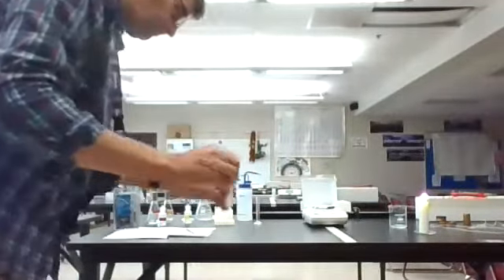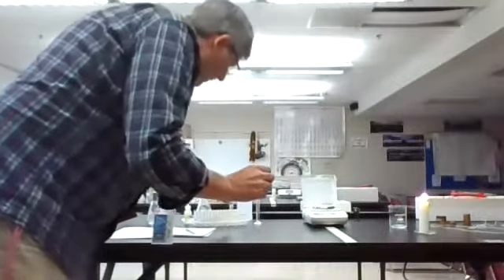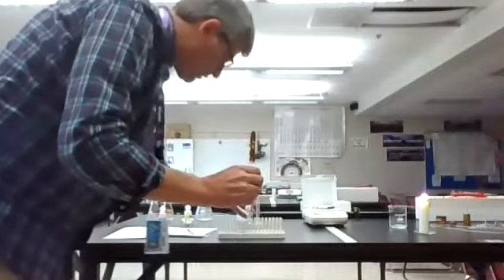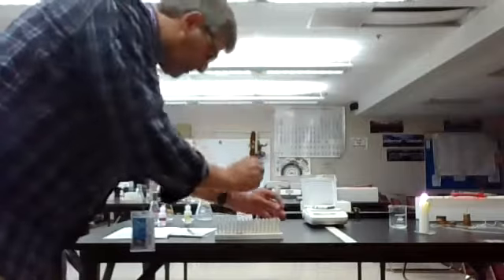Continues to go for a little while. And then shake it, and you can see what happened. There's actually a lot of little pieces left over. So I'm going to move our magnesium ribbon going back to the back, and I'm going to put this one here.